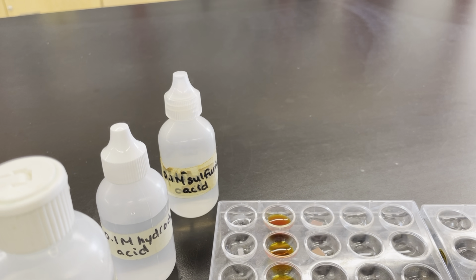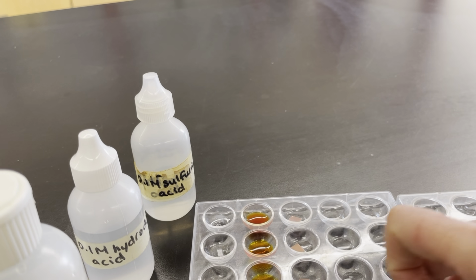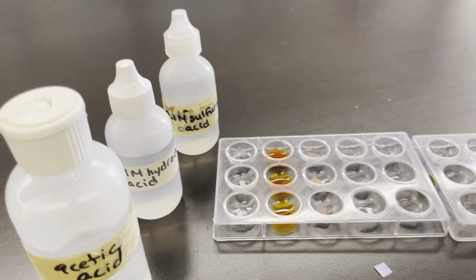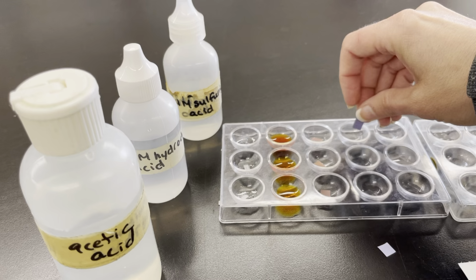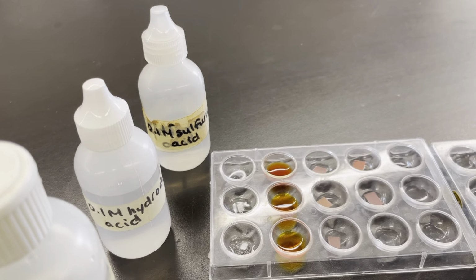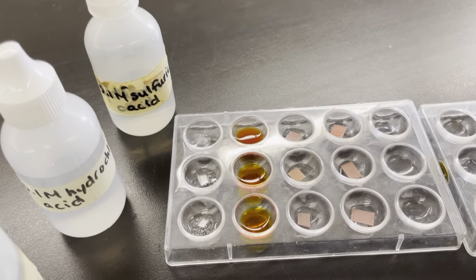For our next test, we're going to use the blue litmus paper instead. You can see this blue litmus paper on the counter. I'll put one in front again so you can use that one for reference. Putting the blue paper in, and we are getting a reaction this time.